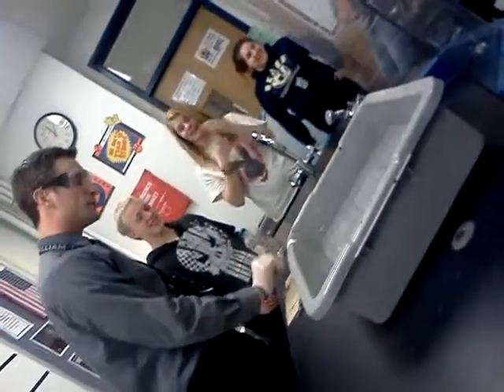All right, we're ready to drop some sodium in? Yep, by the light this time, because hopefully it'll ignite. Not much. In the video we watched, she probably put in about 5 or 6 times this much. So hopefully if we're lucky, it'll ignite. What's going to happen is the sodium is going to rip apart the water again, and then recombine. It'll make sodium hydroxide, and that's what's going to turn our water pink. It'll make hydrogen gas, which is the smoke we see. If we're lucky, the hydrogen gas will ignite. Here we go. Nope. Ignite! Boom!